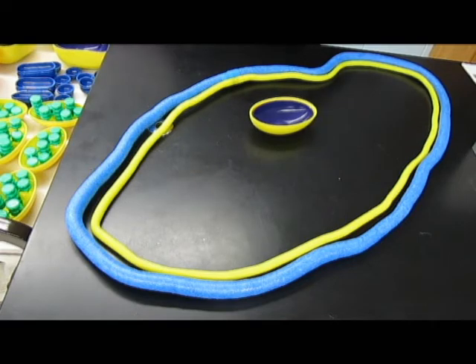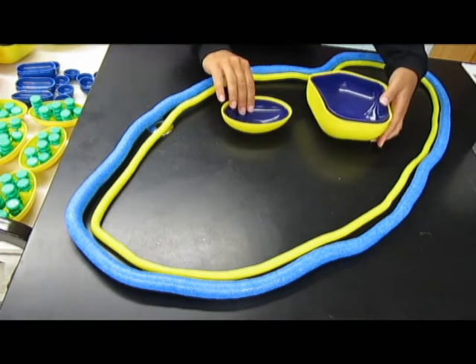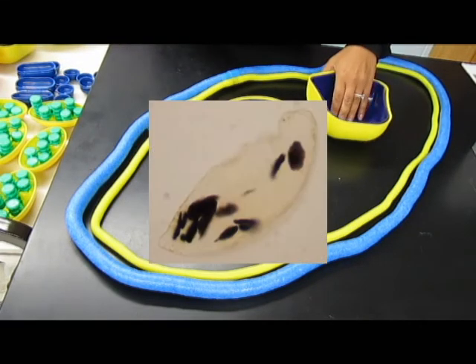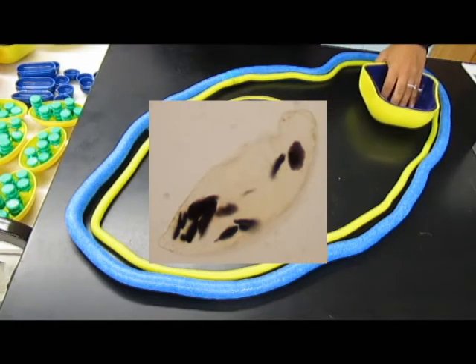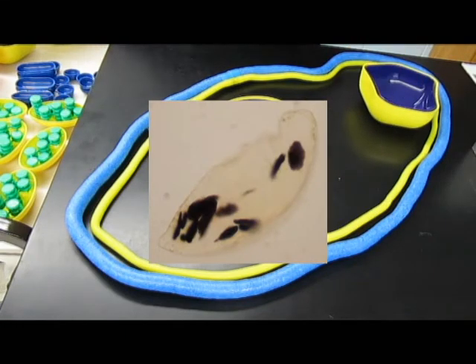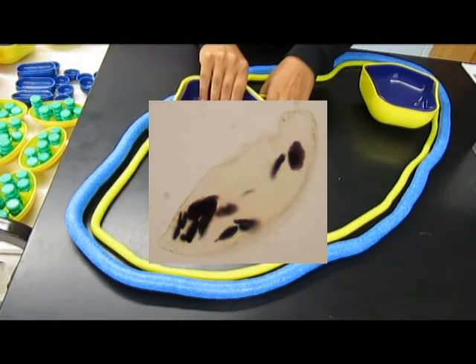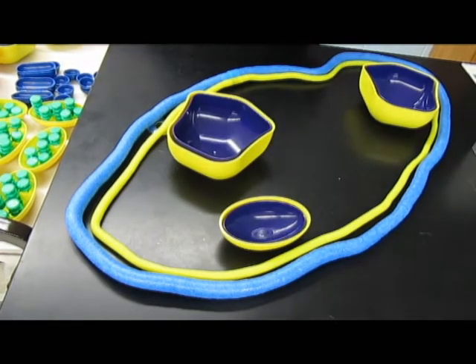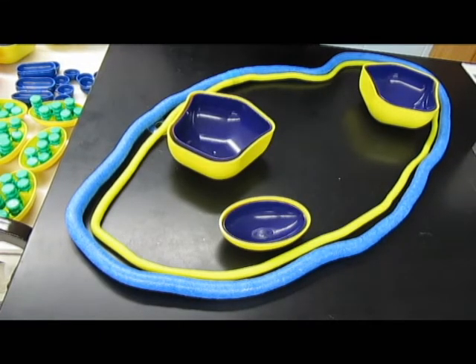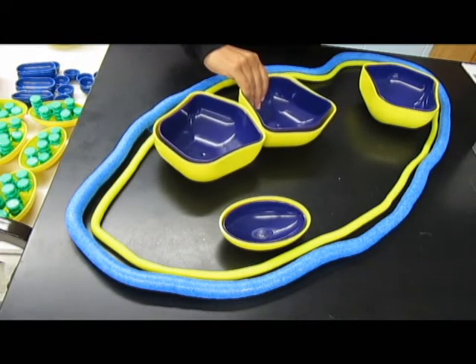We have small amyloplasts as well as large amyloplasts. In the cell that we viewed, there was one large amyloplast way up here, another really large one about over here, and then some other small ones around, and maybe one other large one over here.